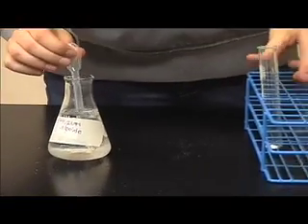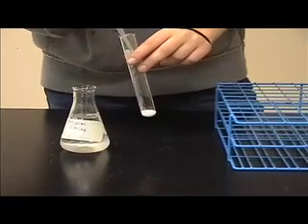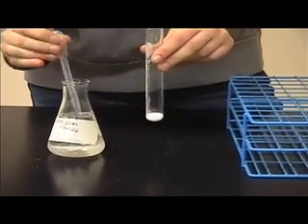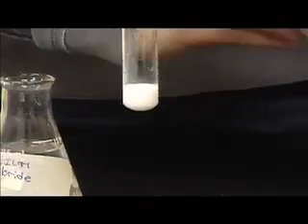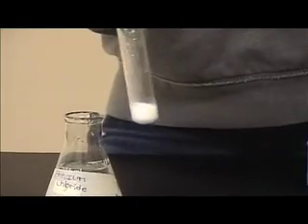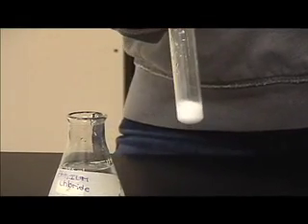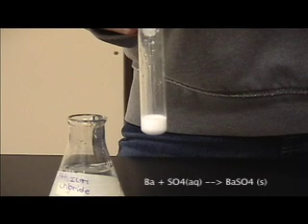So we're going to get just a few drops of this barium chloride, and you're going to see that a white precipitate is going to form. I'm going to put a little bit more in, just so I can get a clear view of this white precipitate forming. So the equation looks like this, and any soluble barium salt plus any soluble sulfate will form a white dense barium sulfate precipitate as shown here. So as you can see in the equation, we have barium plus a sulfate, which will yield barium sulfate solid precipitate.